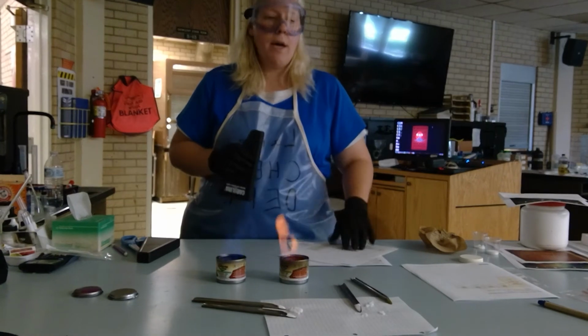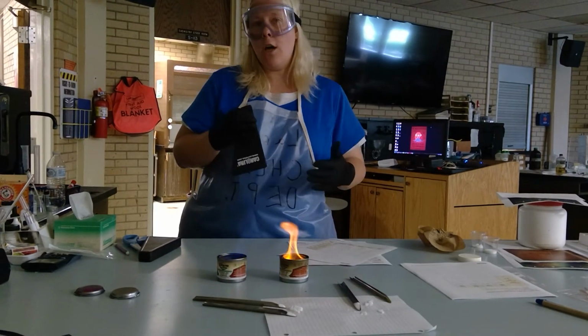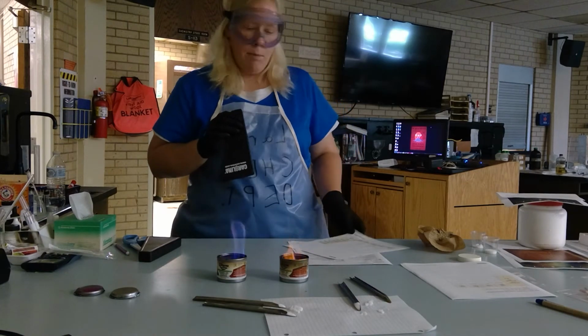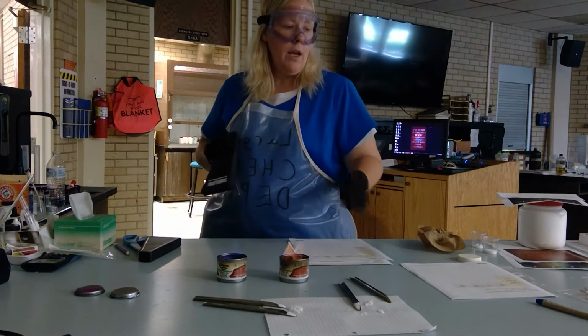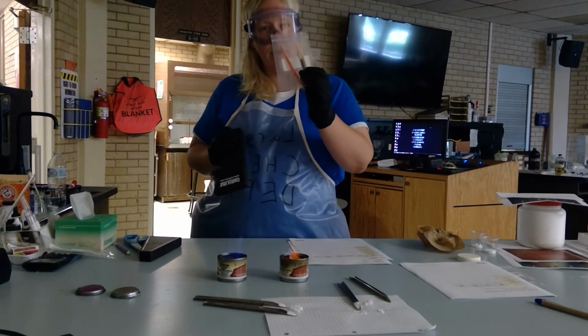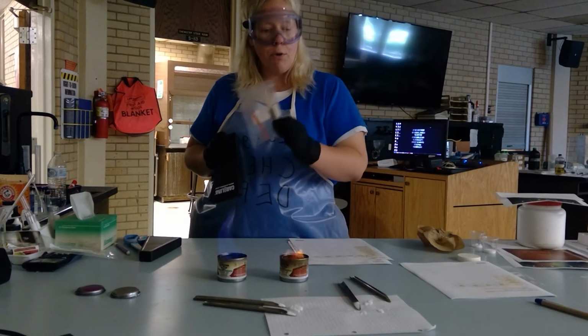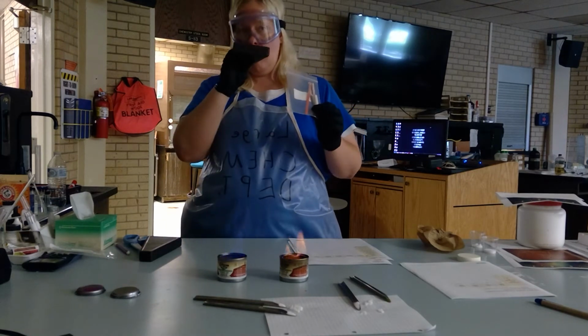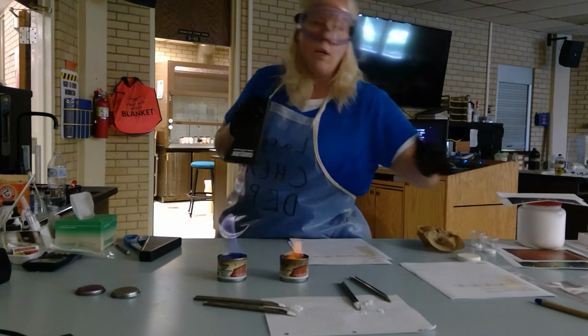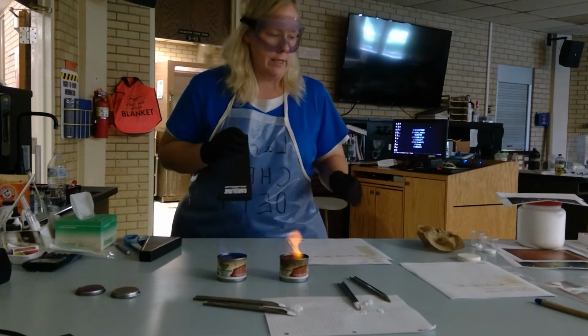But we couldn't get the colors bright enough to appear through here. So that made it a little bit difficult. Now, you do have some sticks. You should have 5 of them. Feel free to burn these in sterno and attempt to look through this. Do it for your pleasure. Experiment with it. You've got the sticks.